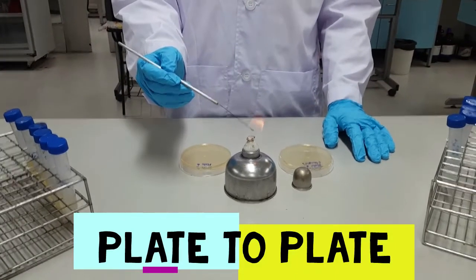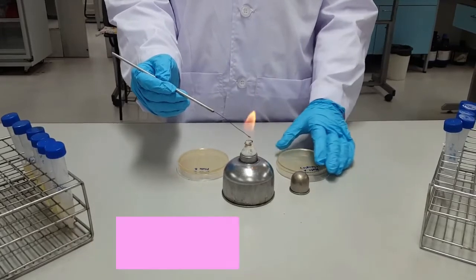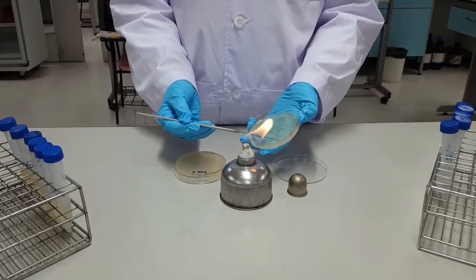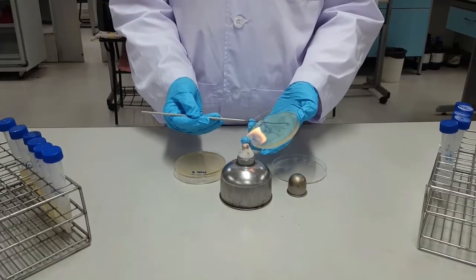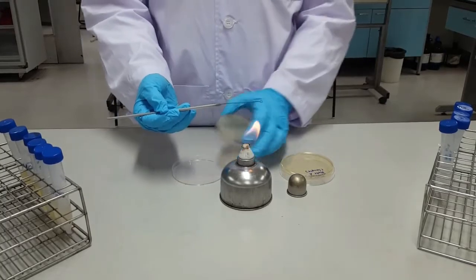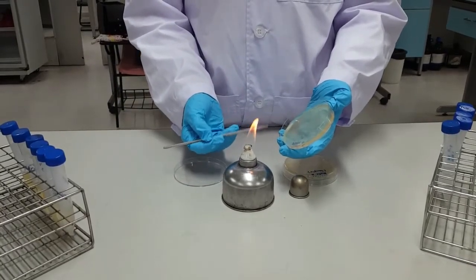And finally, we're going to move a single colony from a solid plate to another plate. I'm going to start by sterilizing the loop at the flame, then touch the loop to the plate to cool it down, and then you're going to pick up a single colony. And be sure to keep the plates near the flame, and pick up the new plate and spread the colony onto it, and then afterward, you're going to want to flame the loop to sterilize.